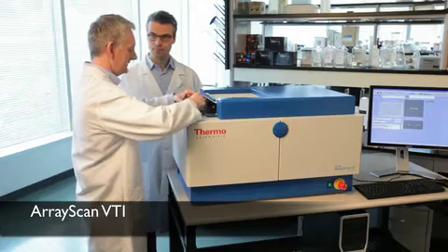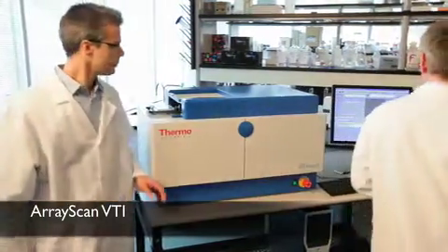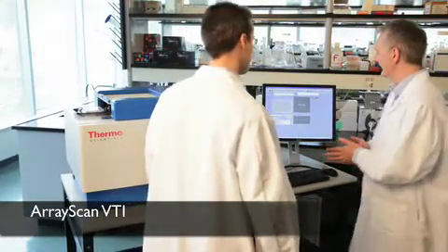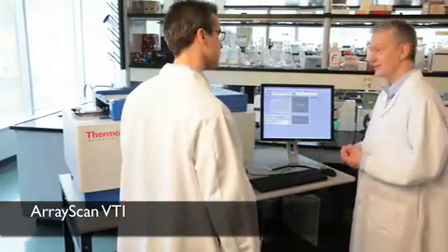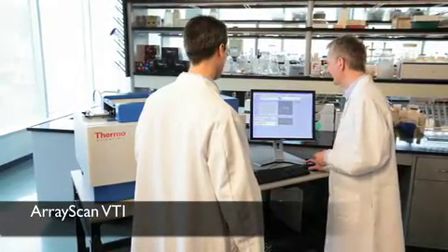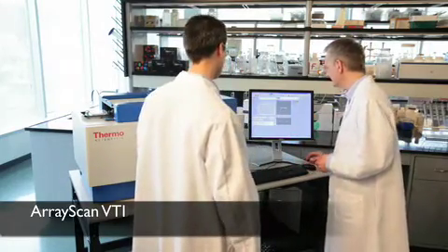Let's pop the plate in and come around here and we'll take a look. Great. There we go. Okay, so one of the reasons why we got this instrument was it's really easy to use. So we have to scan the plate that you brought. It's going to take us a few minutes. And we only have a few things to set up. So let's bring the plate inside the instrument.